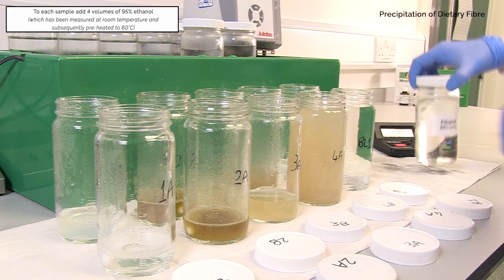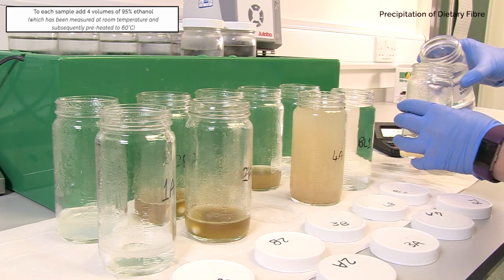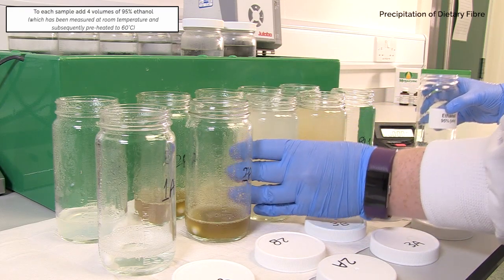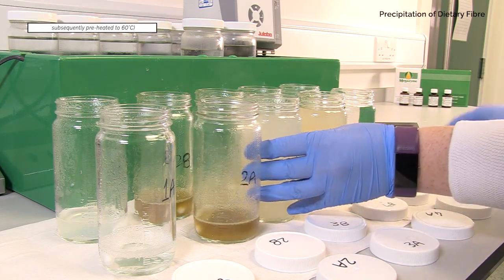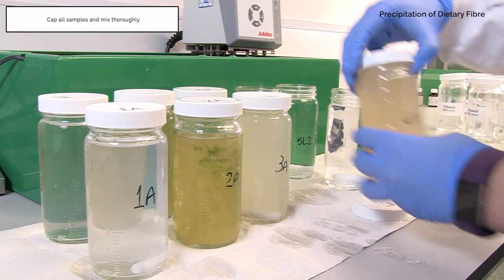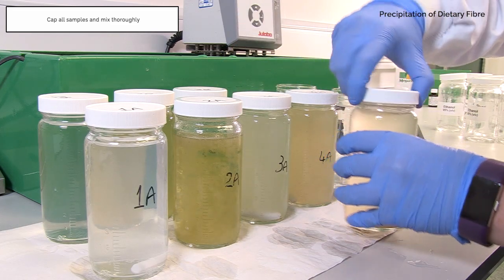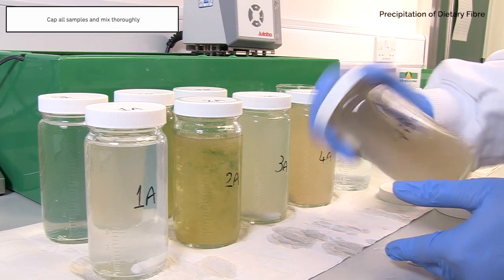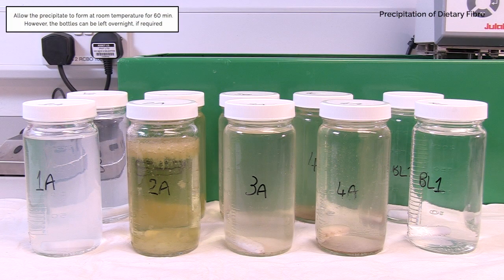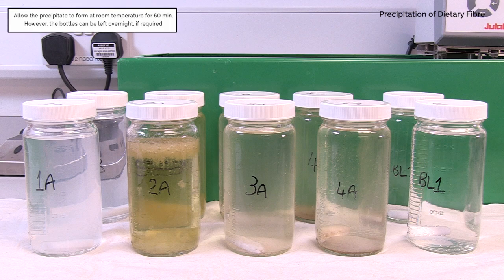To each sample add four volumes of 95% ethanol which has been measured at room temperature and subsequently preheated to 60 degrees Celsius. Cap all samples and mix thoroughly. Allow the precipitate to form at room temperature over 60 minutes. However, if required from a time standpoint, it can be left to sit overnight.